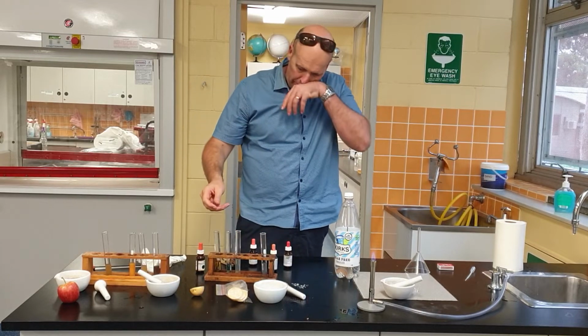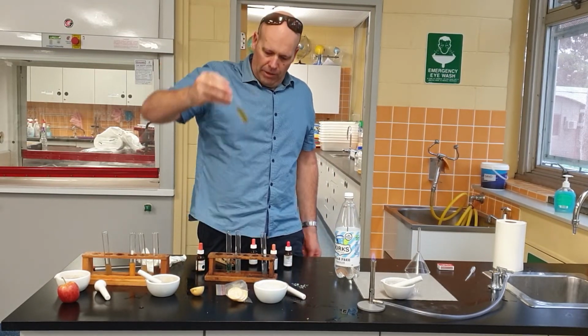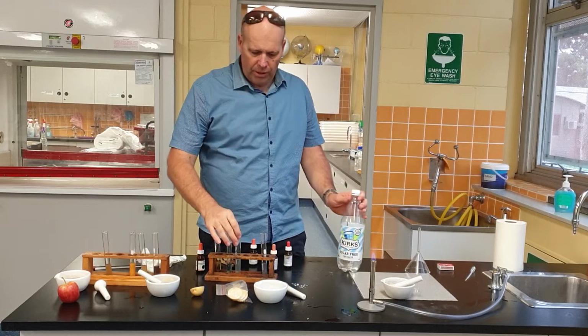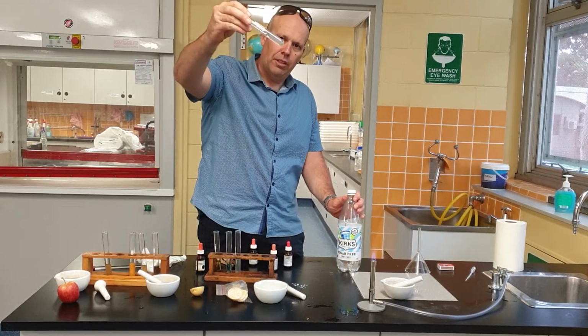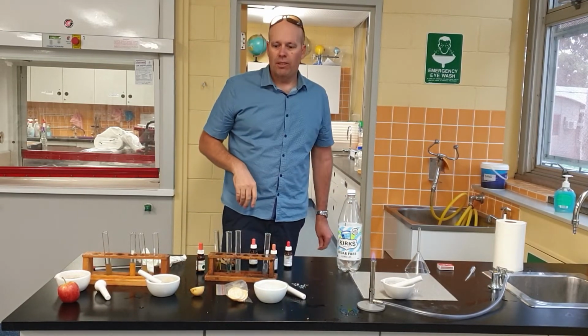So, just start wrapping up. No starch. No glucose, so we verify that it doesn't have glucose. Does it have protein? Jury's still out on that, but absolutely, I think it's got salts. So that wraps us up for today.